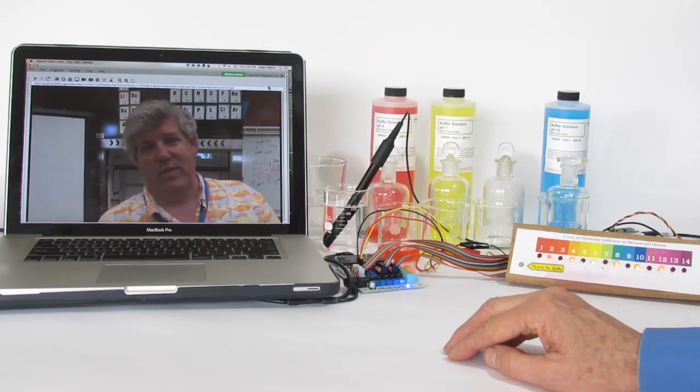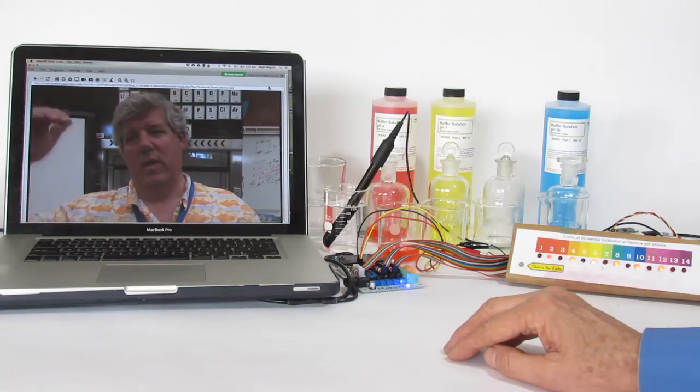To do this process we've got a simple titration. We'll be running through a pipette sodium hydroxide and we'll be adding that to an unknown acid. We'll be adding it a little bit at a time. So let's go ahead and get started.